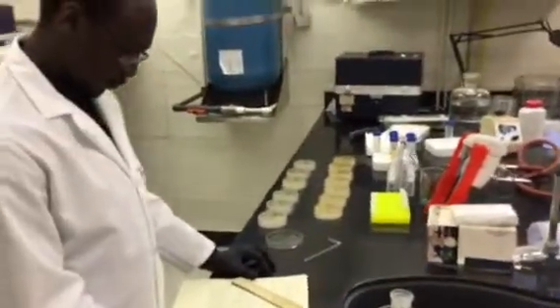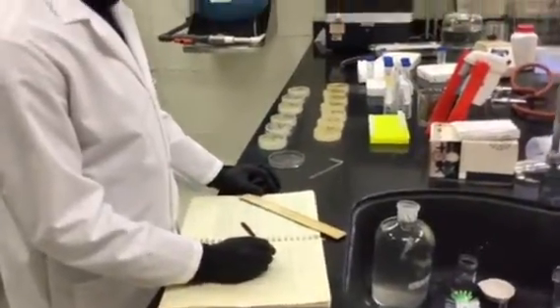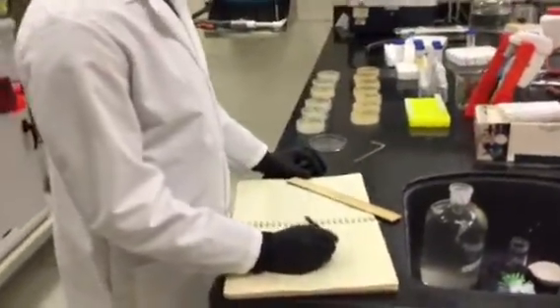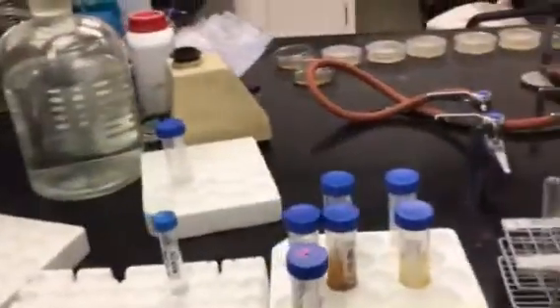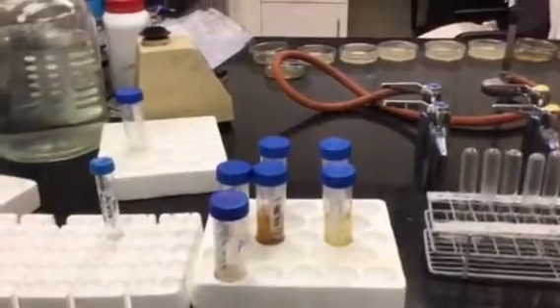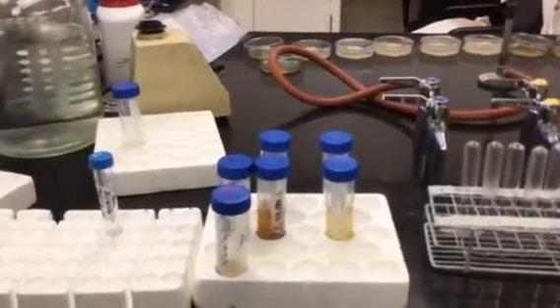So Mr. Thomas Heil here is looking at the results from his work to figure out what the concentration of his E. coli titer is, and also his MS2 titer. So what he did was take an E. coli strain. We call it F-amp, and that was from one of these vials here. It's simply the E. coli that had been grown in TSB, trypticase soy broth, and that was incubated so that it's at a log phase of growth.